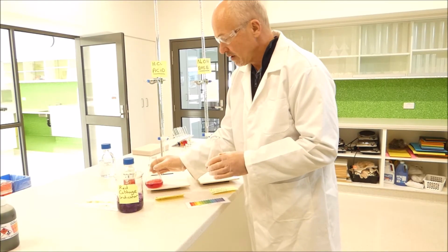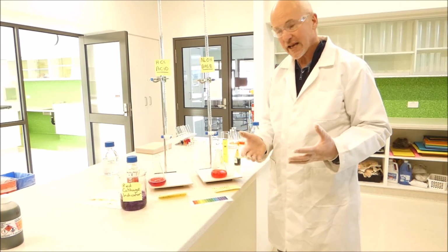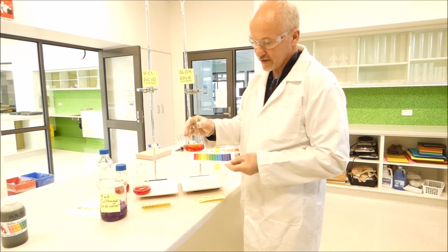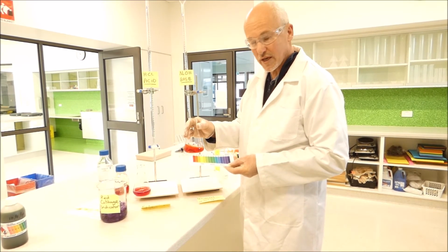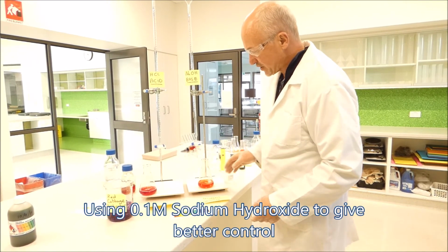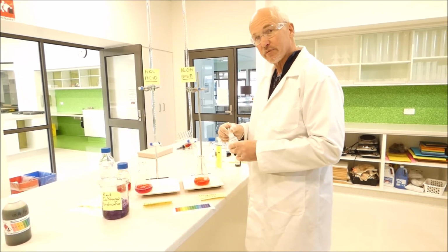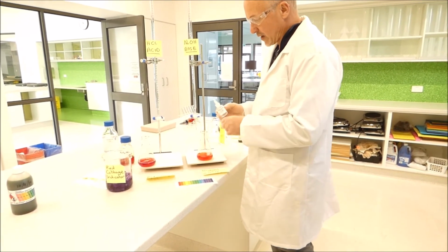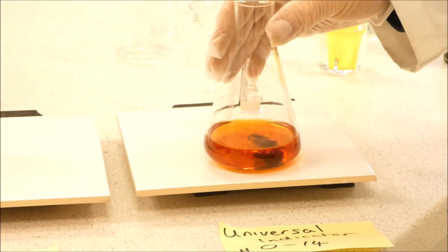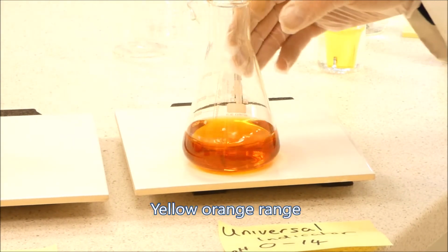What we're going to do now is show you the colour range as we add more and more sodium hydroxide. Okay, so the universal indicator, as you can see now, is nice and red, so it's around pH 0, or maybe pH 0 to 1. And we're going to try to change it through its colour range by adding a slightly weaker solution of sodium hydroxide than we did previously, because it was changing way too quickly. So we'll add a few drops at a time. It shows how accurate these pH indicators can be, because they can be changed by a single drop.